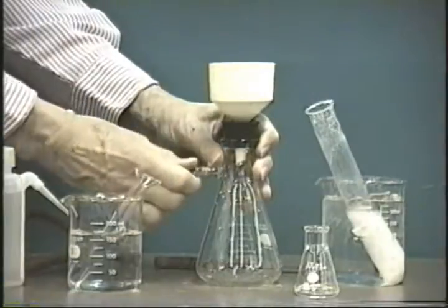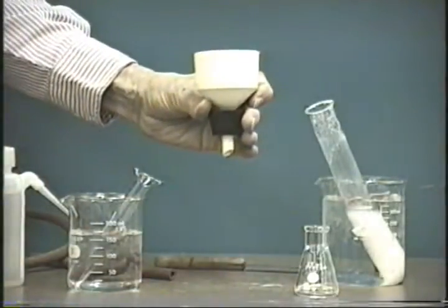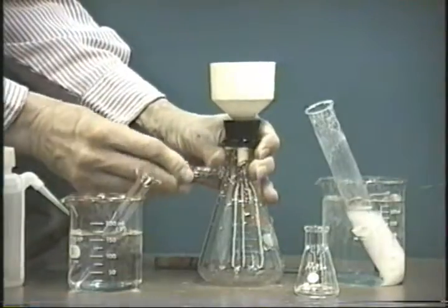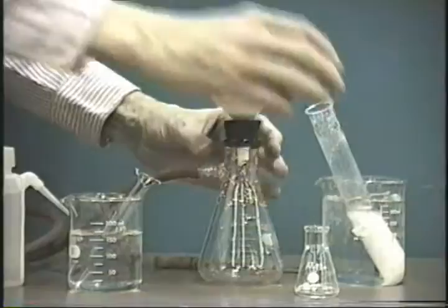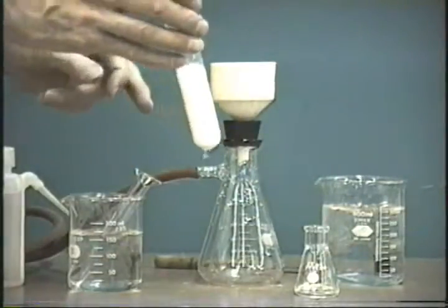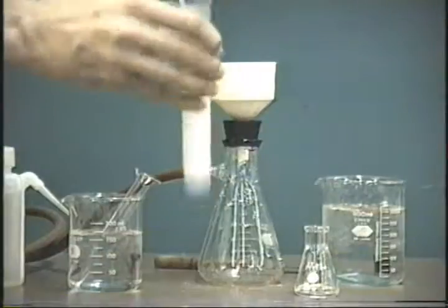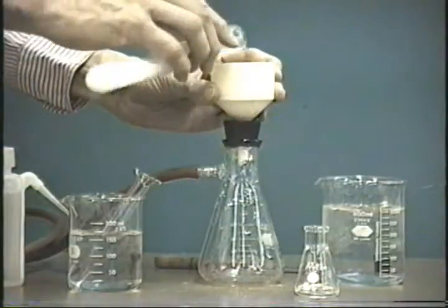And now what we'll do is we'll get rid of the little extra water that we put in here. So we'll get rid of that water. And now we can start the filtration itself. We'll reconnect the vacuum line here, make sure it is seated properly. And now we'll slurry up the precipitate here so that it's suspended back into solution. And when it is all suspended, we'll just pour it into the funnel.